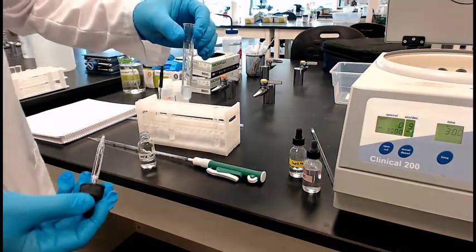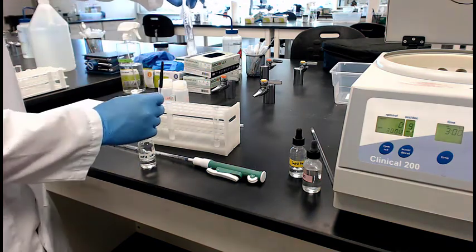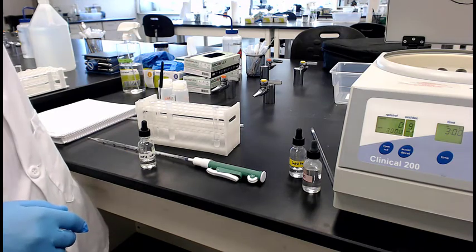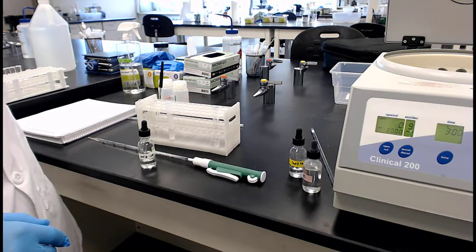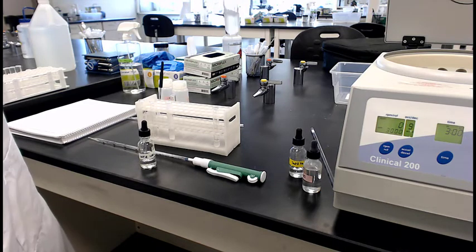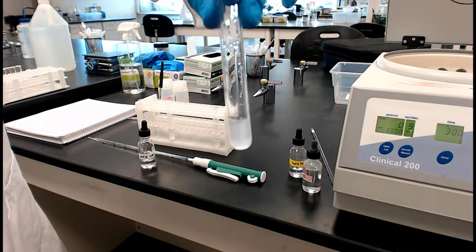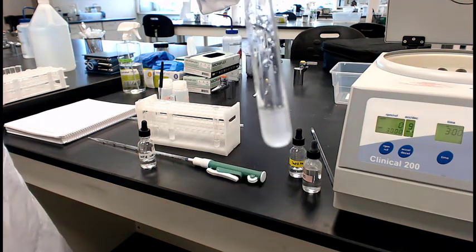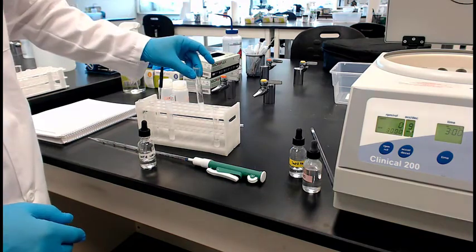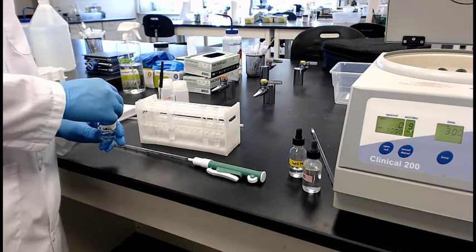All right. Please, yeah, there you go. Stir it, stir it, stir it so we can see what you're doing. There we go. All right, so it clouded up a little bit, made a little bit of precipitate out of there. It's kind of hard to see.